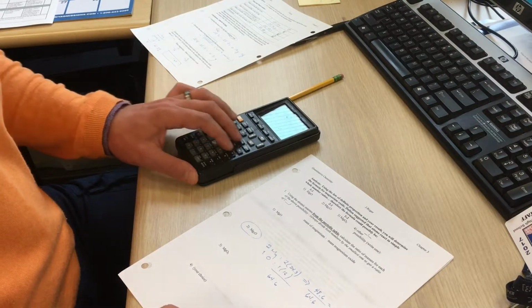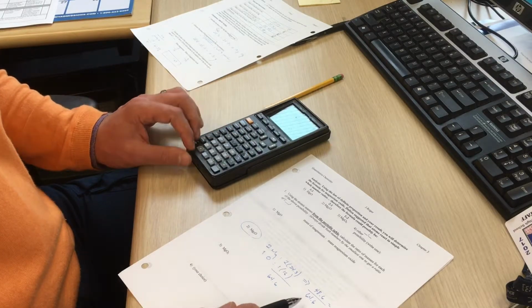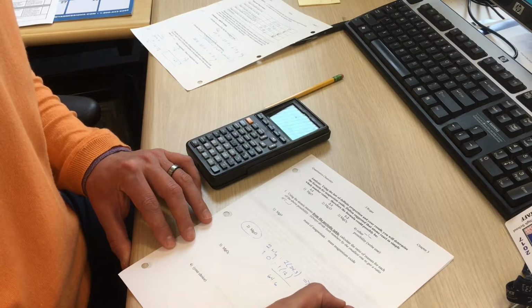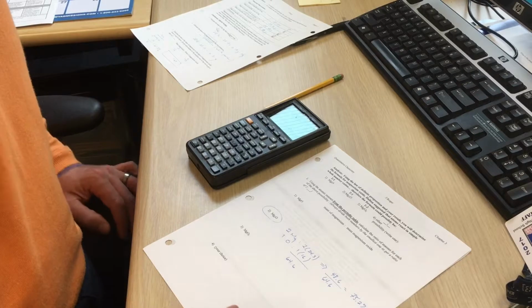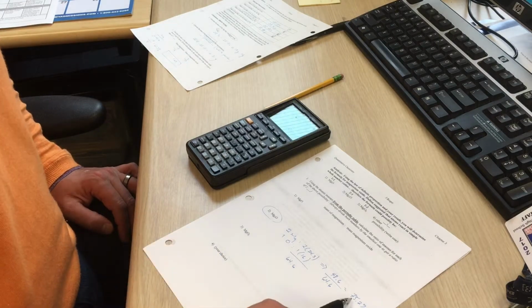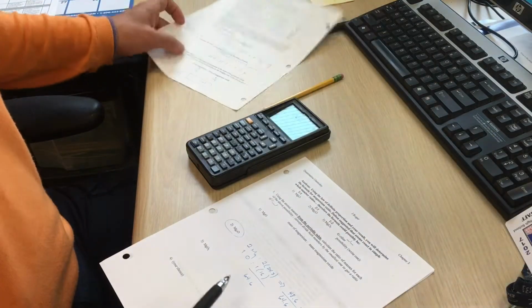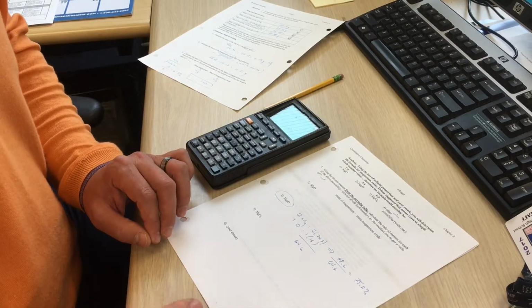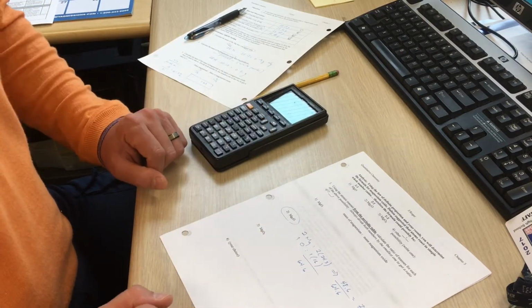In this case, we can see that it's not going to match, because 48.6 divided by 64.6 times 100 to get a percentage is equal to 75.2%. So I can deduce that the magnesium oxide that I made is not Mg2O, because the proportions of magnesium don't match. I would repeat that for the other two, and your choice, and hopefully one of your percentages is going to match, which would tell you the actual formula for the magnesium oxide that you produced.